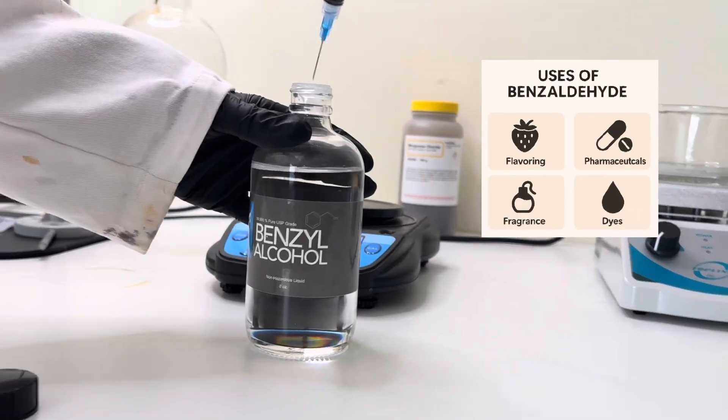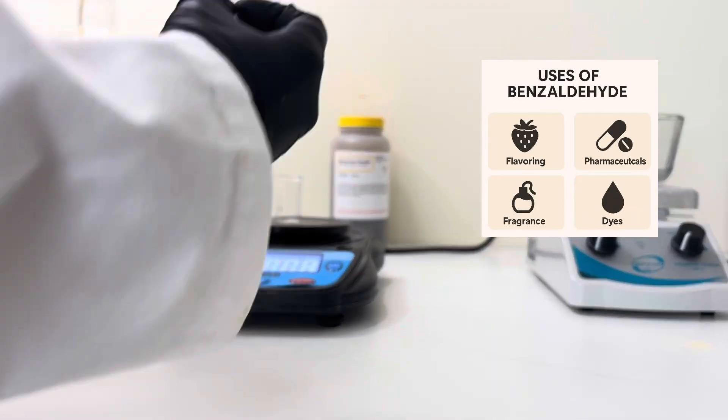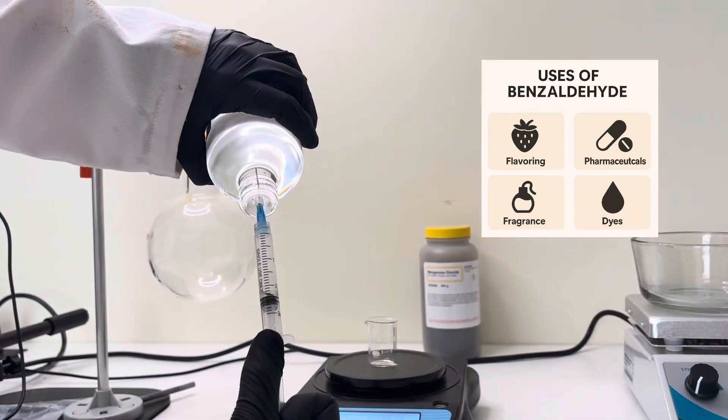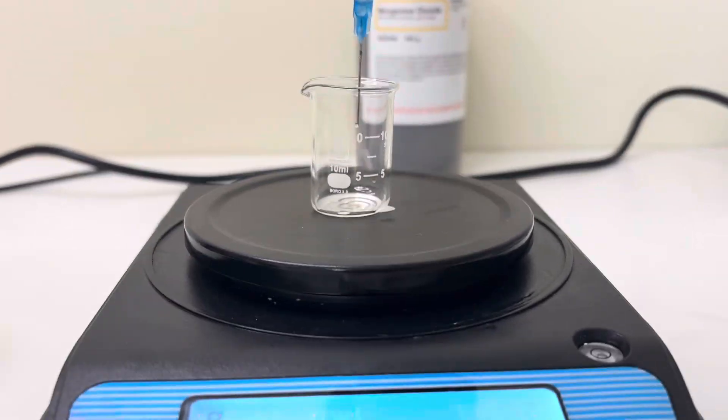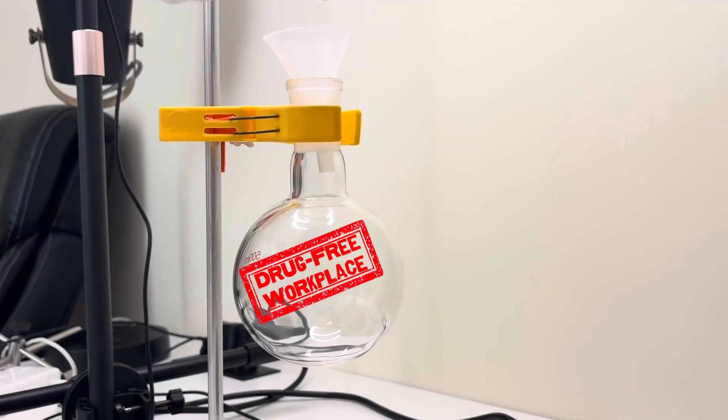Some uses of benzaldehyde are in fragrances, flavorings, pharmaceuticals, and dyes, and also illegal drug synthesis, but this is strictly for educational purposes.